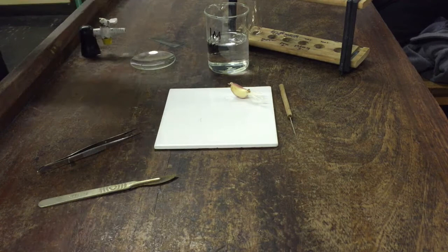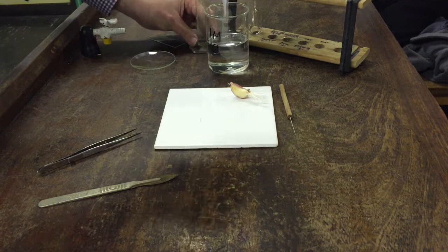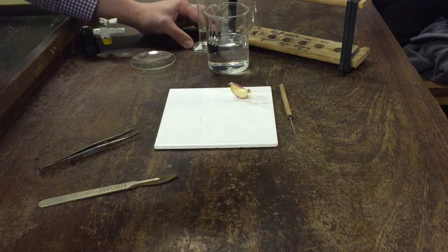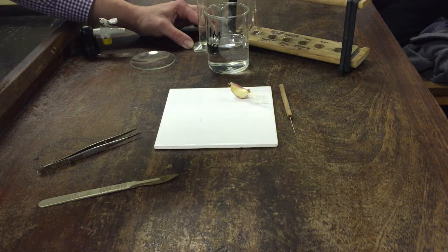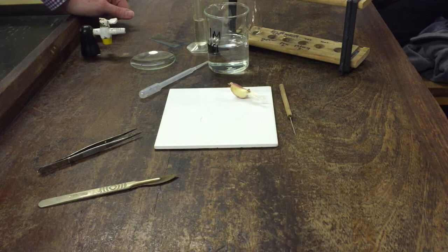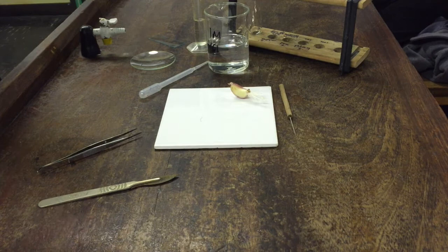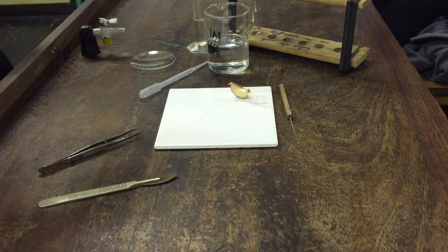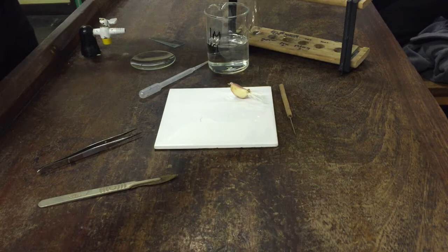You're going to take hydrochloric acid, you need about 10 milliliters, it doesn't have to be precise. You should be wearing goggles while using the hydrochloric acid. The job of the hydrochloric acid is it's going to interact with the cellulose cell wall and break it down. What's the technical name of the process of breaking down the cellulose? Hydrolysis. So basically we're doing hydrolysis of cellulose which you'll learn more about in topic four.